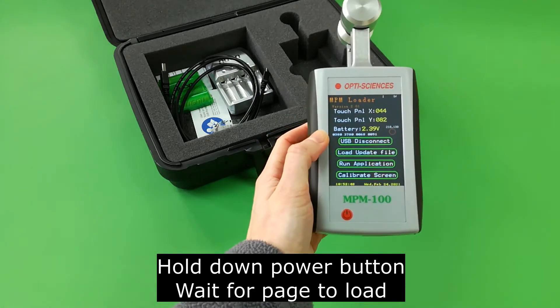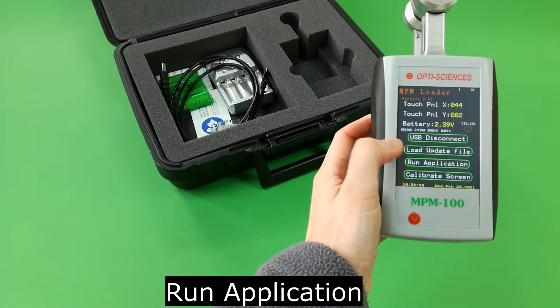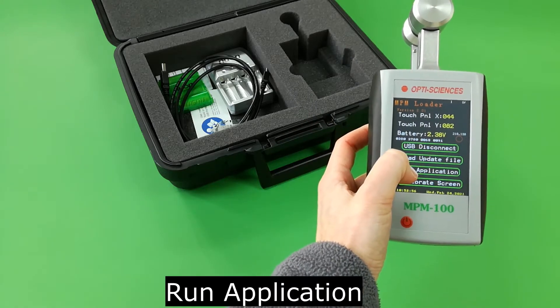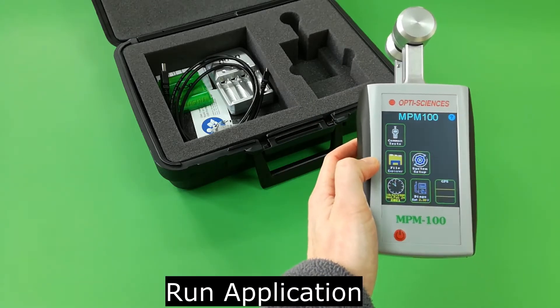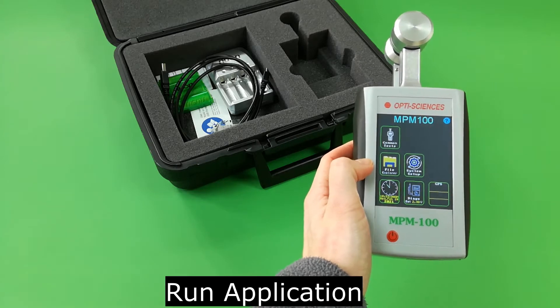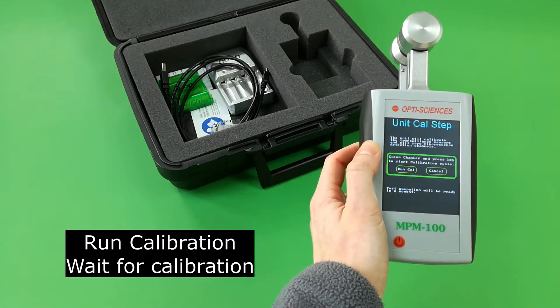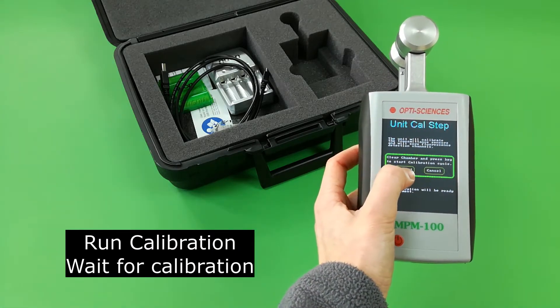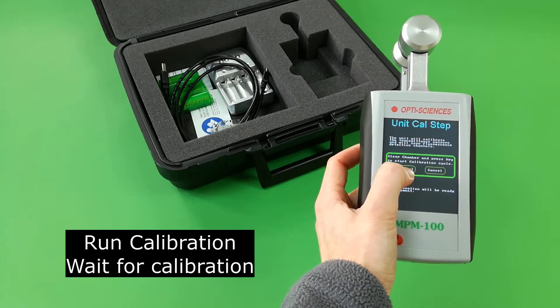Press run application. To calibrate the MPM, press run calibration and wait for calibration of all sensors and detectors to complete.